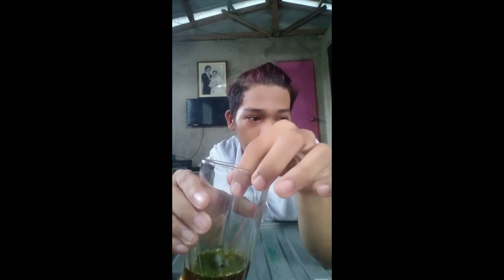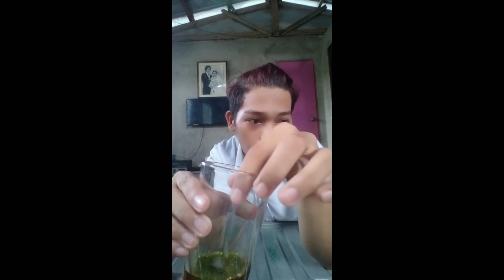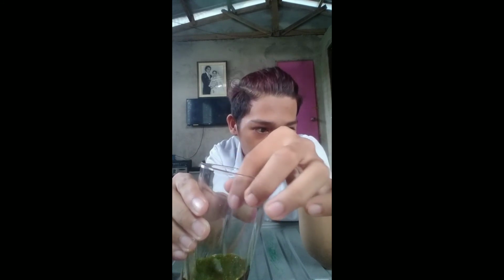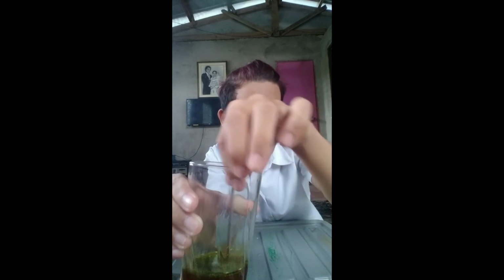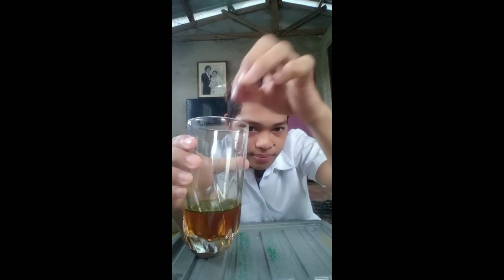Ion-dipole force is quite strong. In fact, their attraction is so strong that water molecules and ions stick together strongly, so that they push the acetone upward, or they separate the acetone. See?